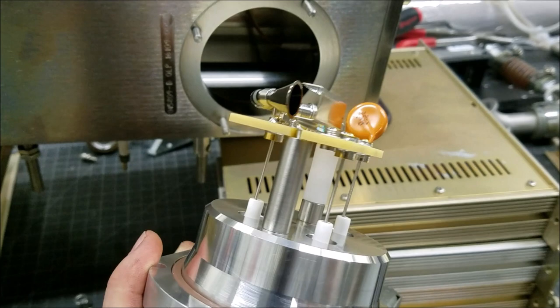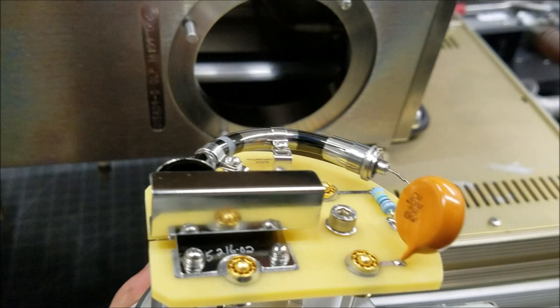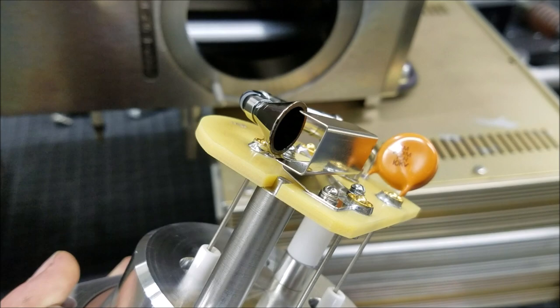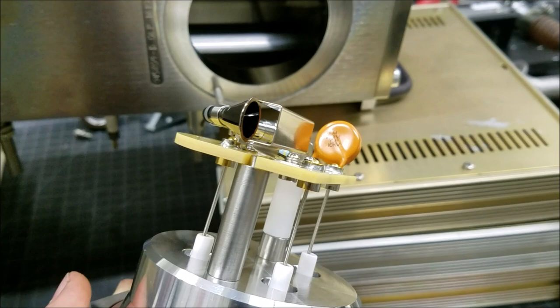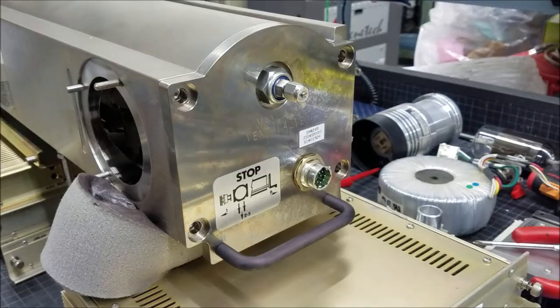Here's the ion sensor — I can't say I've quite seen something like this before. It looks like there might be a top plate and a weird-looking tube thing, like some sort of ion trap, but that's cool. I wonder if Adam knows exactly how that works, but it definitely looks like the ion detector and it appears to be capacitively coupled. And then there's the back of the quadrupole mass analyzer — let's go ahead and open that up.